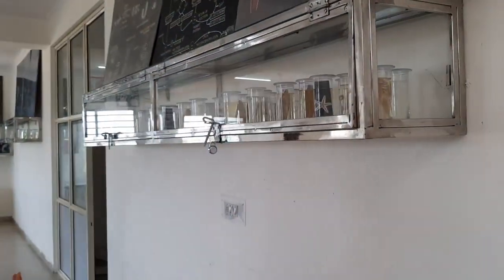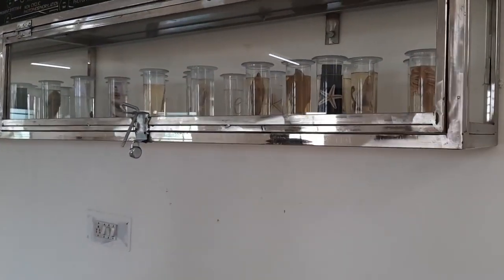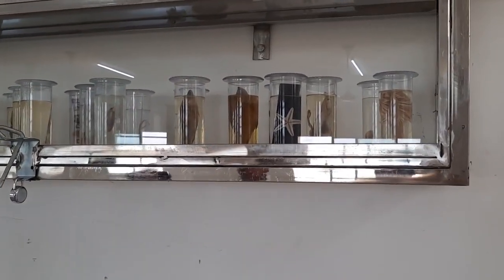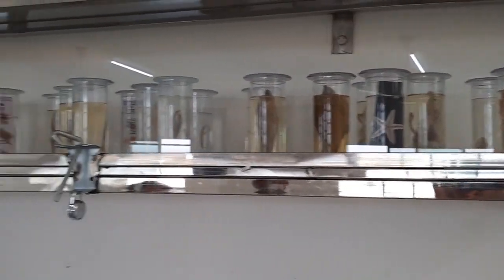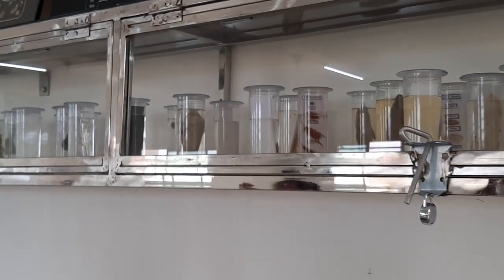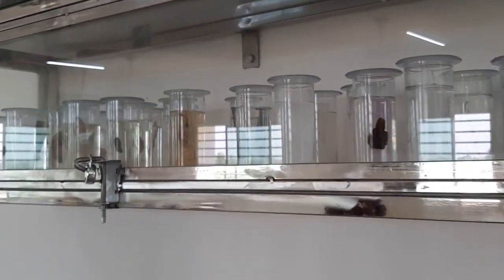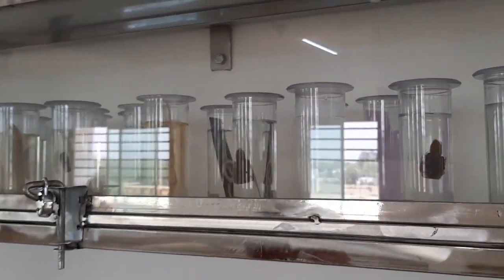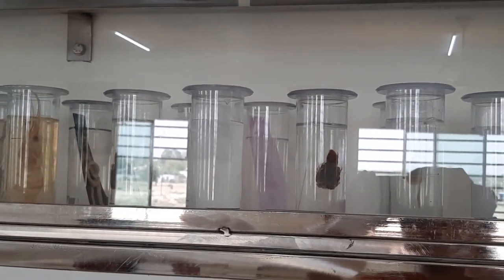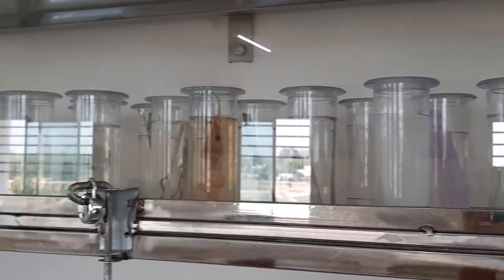In the Biology Lab, what things are present? First of all, these are the specimens. These specimens are all of animals — aquatic animals or terrestrial animals.